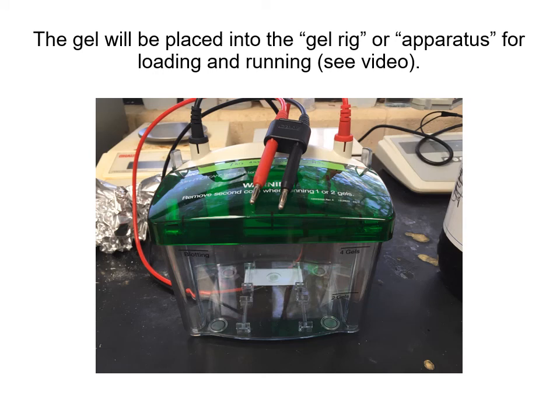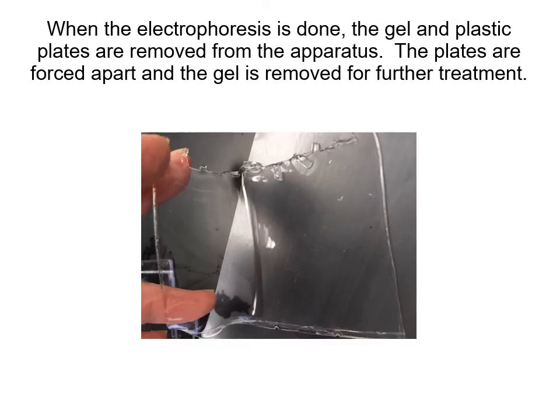Here's a picture of a gel rig, the kind we would use, or apparatus for loading and running the gel. And you could look at that on the video. And here is when you've torn apart the plastic plates, and the gel itself is kind of floppy and gooey and easily ripped if you're not too careful. So this is what it actually looks like after you get it out of the gel apparatus.